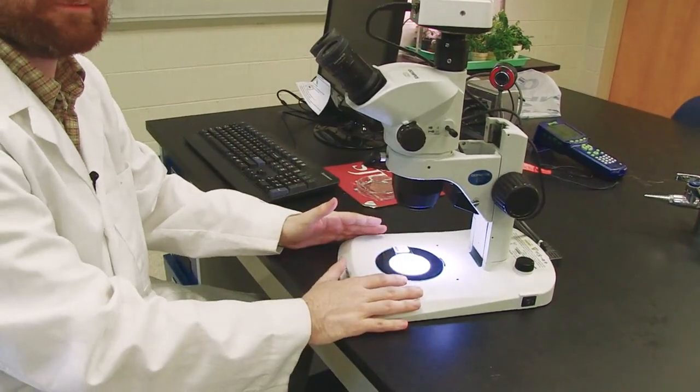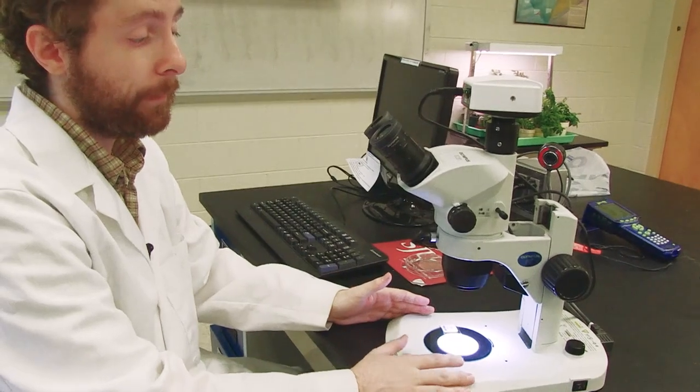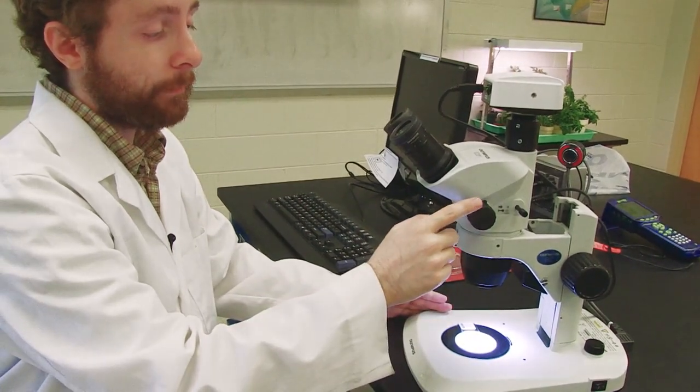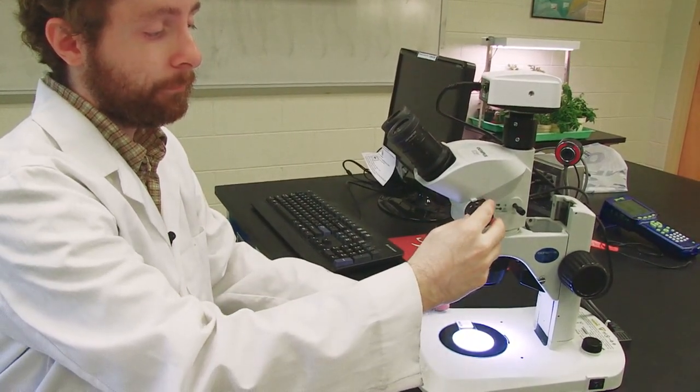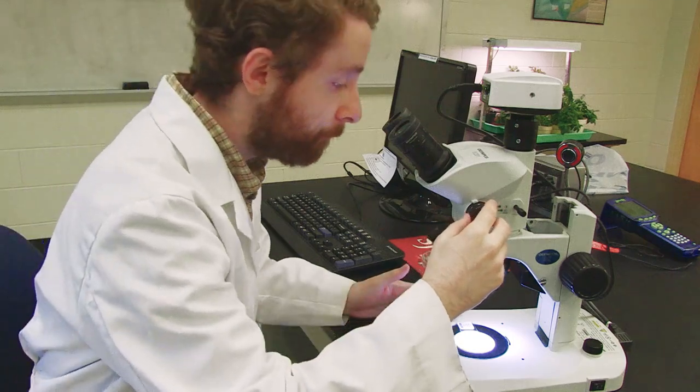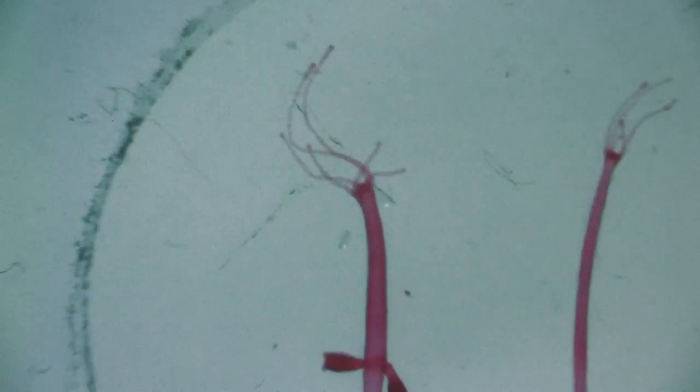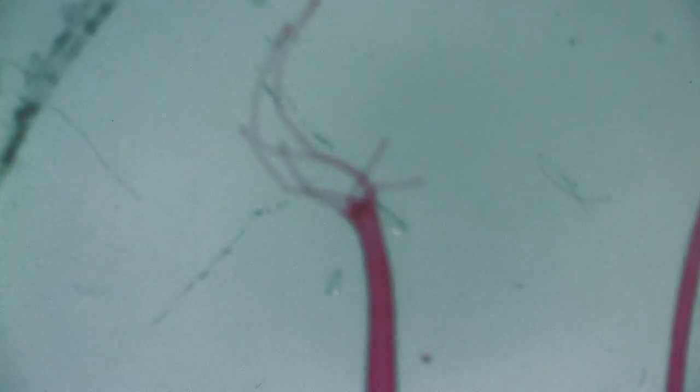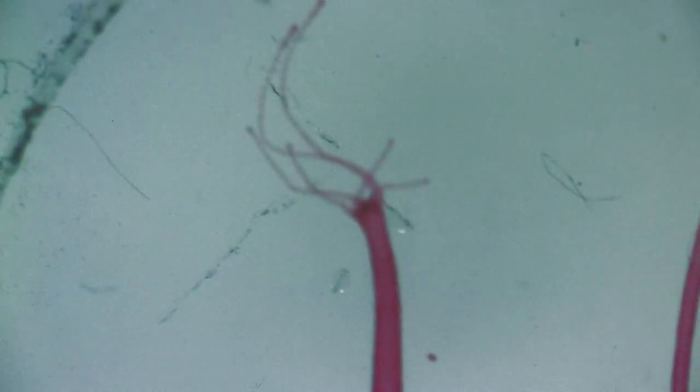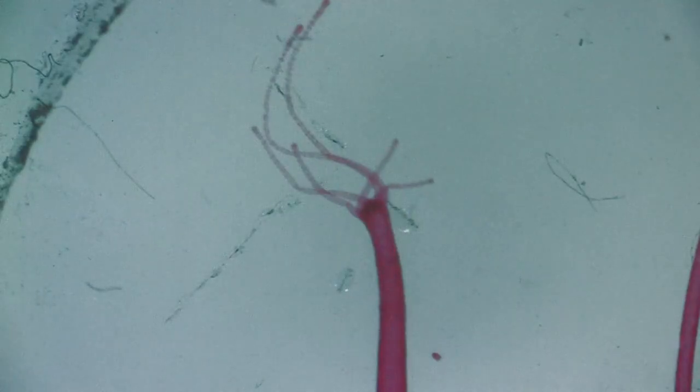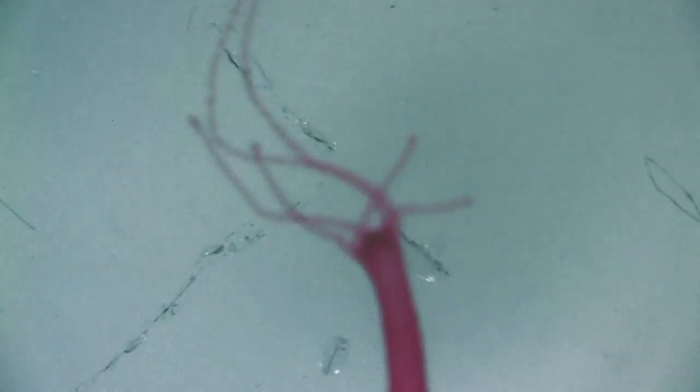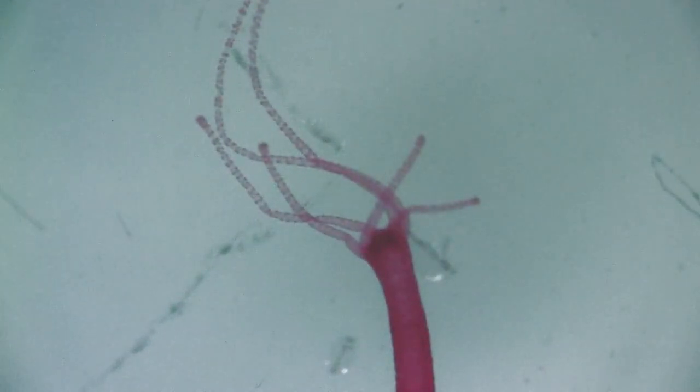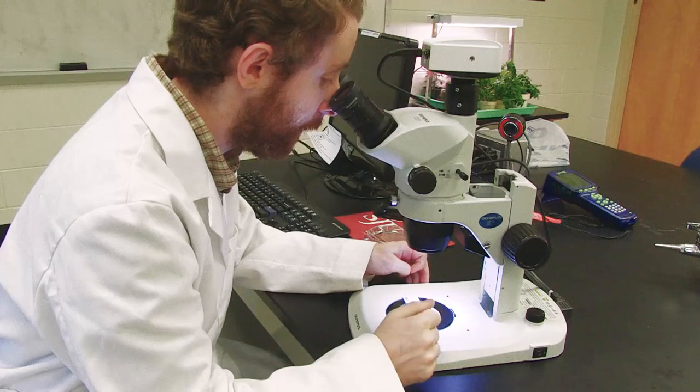My specimen on my slide is now in focus. I can now, using the zoom function, zoom in to get a closer look at a particular structure. In this case here, the tentacles that are on the hydra. You may have to readjust the focus knob a little bit as you do that. And there you can see the tentacles that are coming off of the hydra.